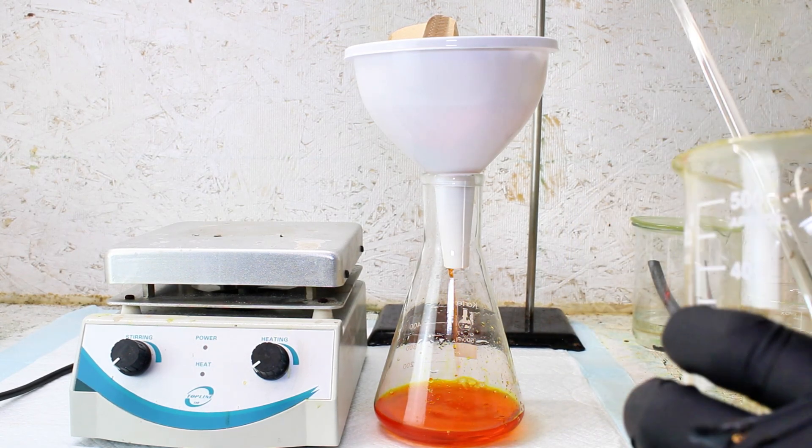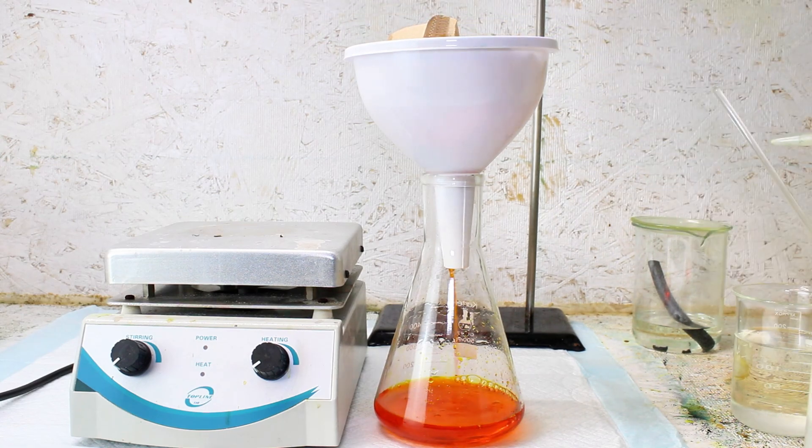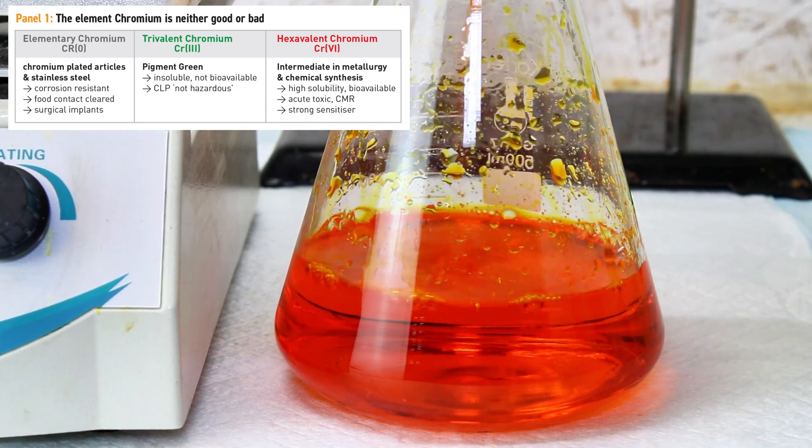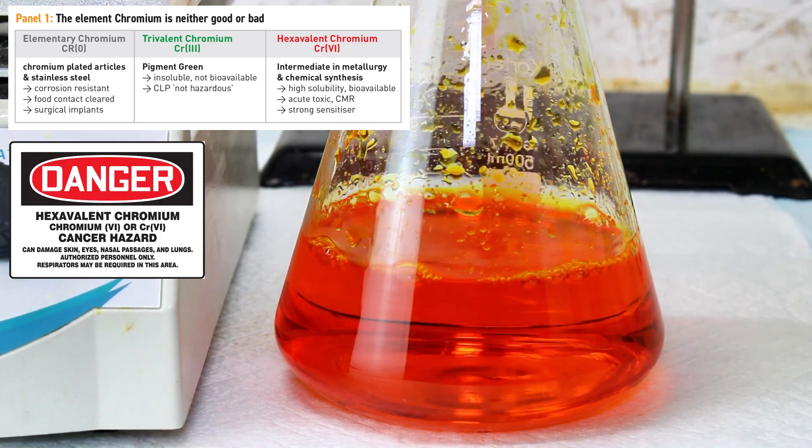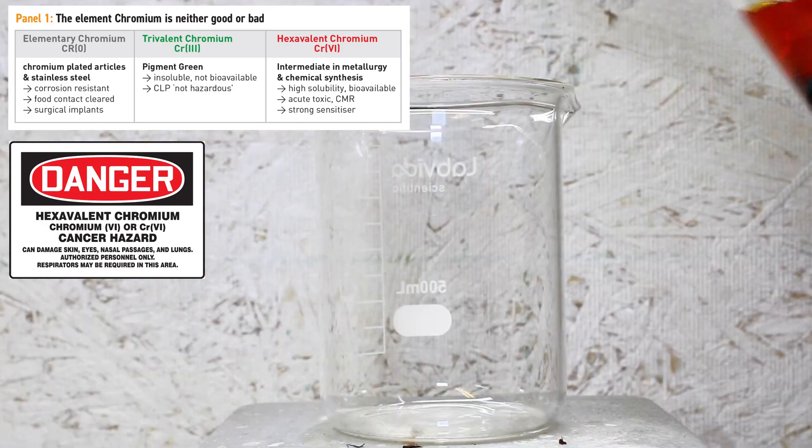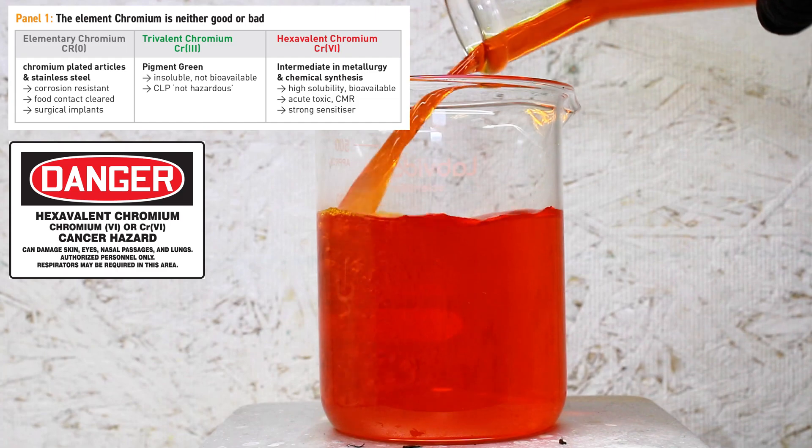Now, it's probably a good time to mention that despite the beautiful color of this chemical, it's an extremely toxic mutagenic carcinogen. This chemical is one of the few times I've seen a four in the blue box of a hazard diamond, and it should not be handled by anyone without proper training and safety equipment.